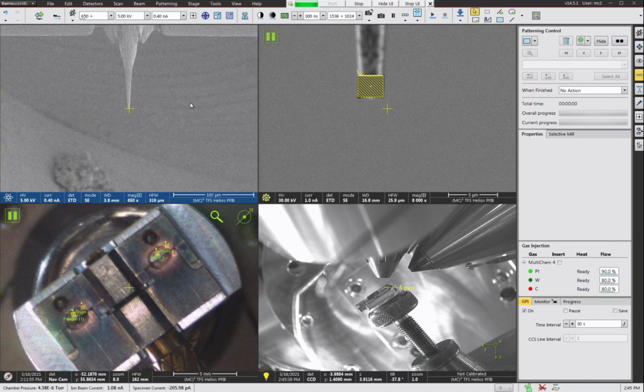So that's basically the procedure. So we got 3 milling cuts. Again, we got the 0.5 microamp cut to do the rough shaping of the post, then a 60 nanoamp cut to make it into the nice kind of conical post shape, and then a 1 nanoamp cut from an angle on the side to chop off the top and give it kind of a flat top to set on. And on our PFIB, we can do that at minus 38 degree tilt, or you can do it at minus 10 degree tilt.